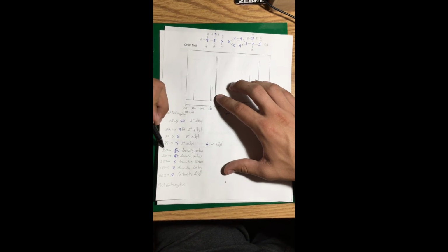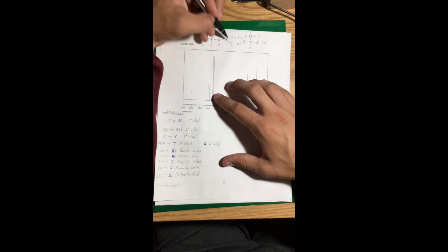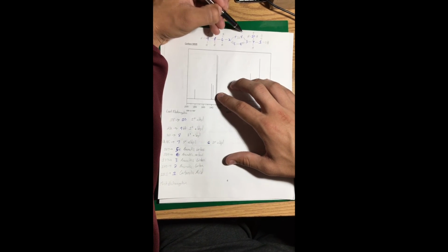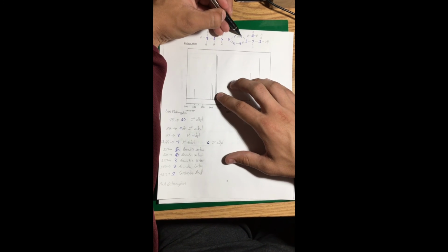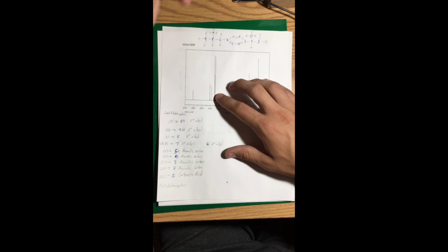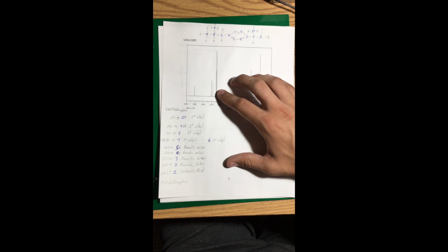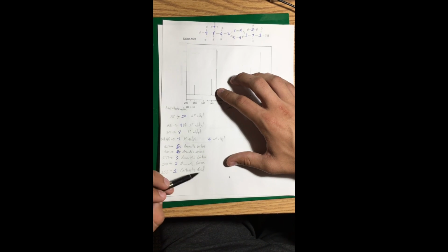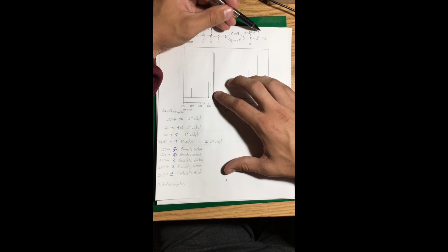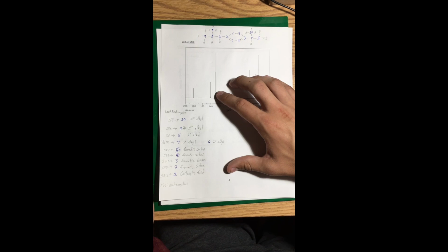The first 127 and 129 both have 2 carbons they represent, an aromatic. 5 being these 2 because it's farthest away from electronegative, and then as you move down, it'll be closer, so 4, and then 3. And then the 2 actually comes over here because the aromatic pulls charges, so making this a 2. And then on the last one, 181 represents carboxylic acid, which we know to be very electronegative with 2 oxygens on it. That is labeled number 1 because it is the most electronegative.